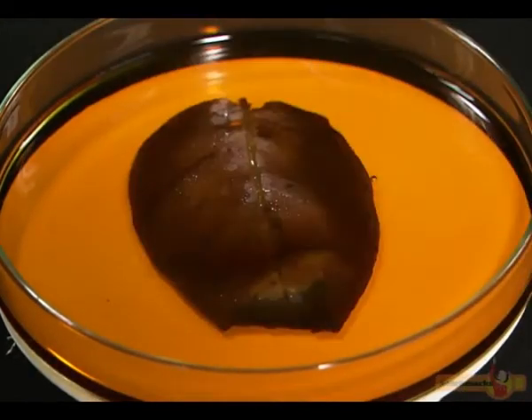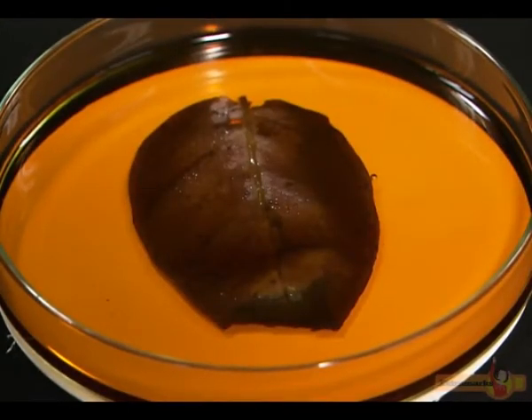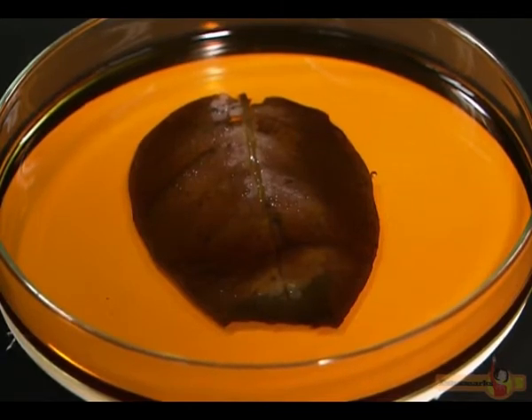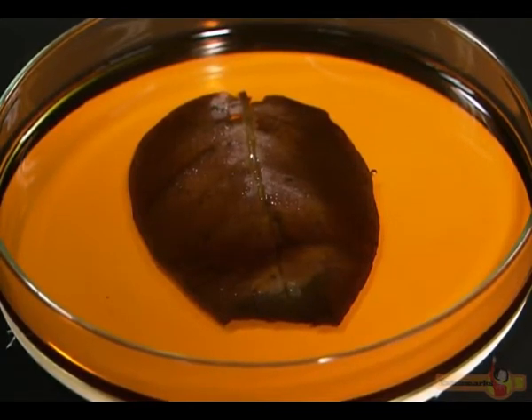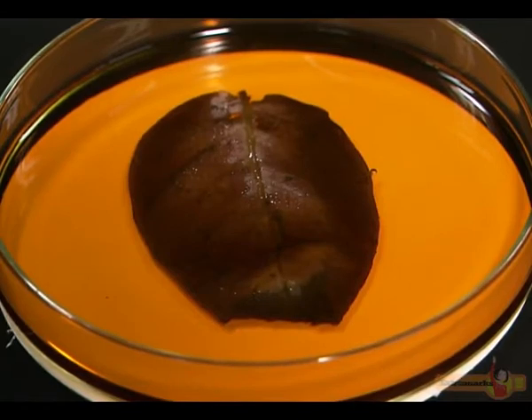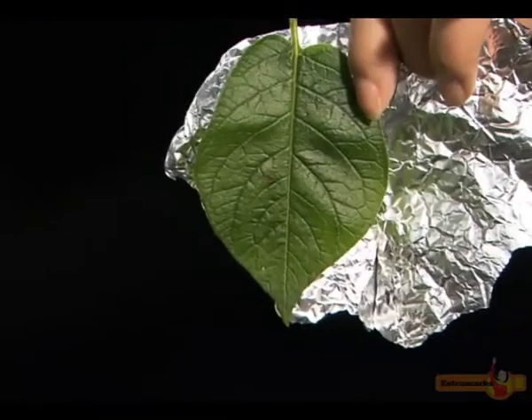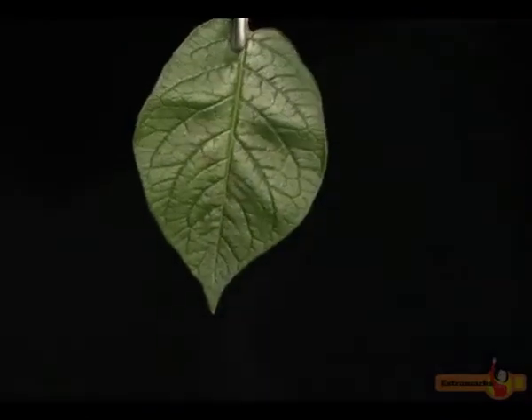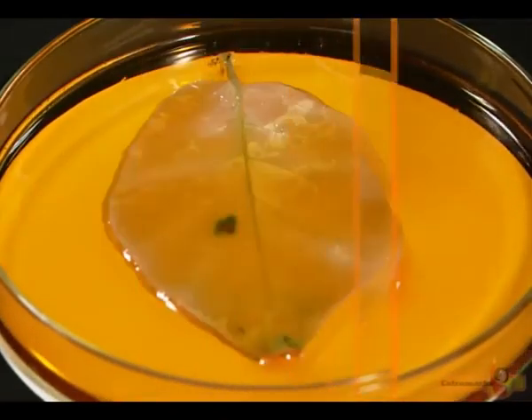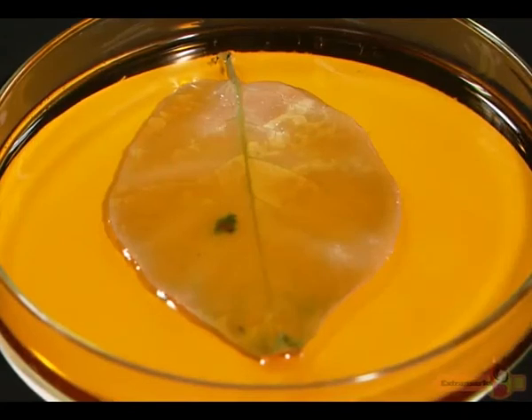The leaf exposed to sunlight turns blue-black, a bluish purple in color, which demonstrates that photosynthesis was going on in the leaf, therefore producing starch. On the other hand, the leaf that was covered does not show any evident change in color and gives a brown color with iodine.